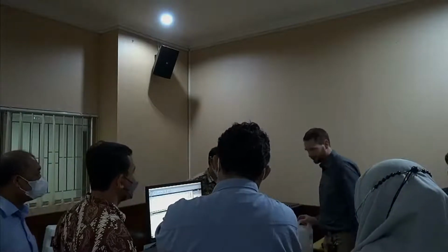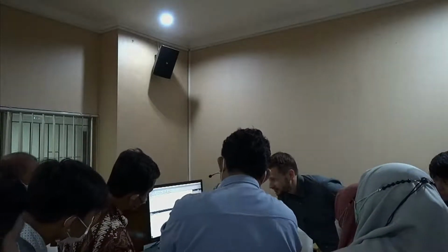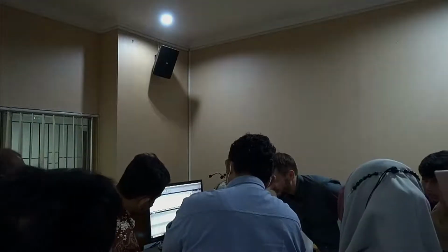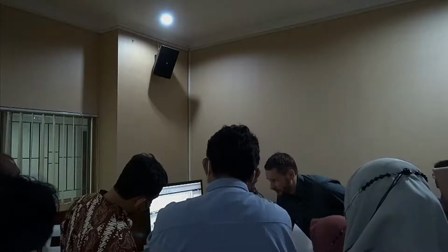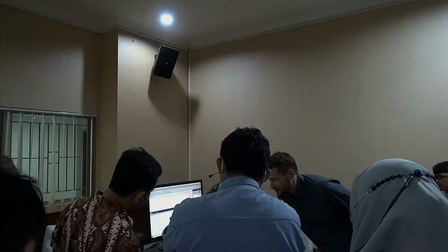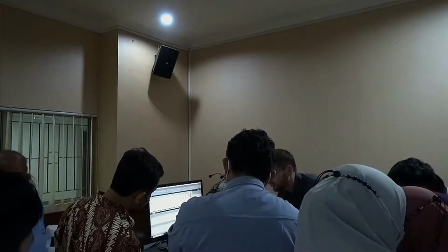So, again, very nice results. It is an easy sample, I have to admit, the coconut milk. It's a little finer than the F500, so if we check the values again, the D50 is around 7 micrometers, our D10 around 2. But again, three very nicely reproducible results. Actually, from the variation coefficient, for some natural material, quite good.